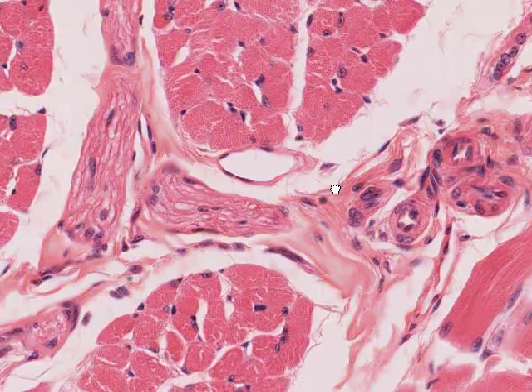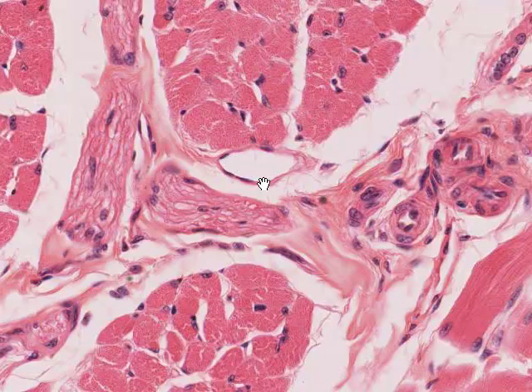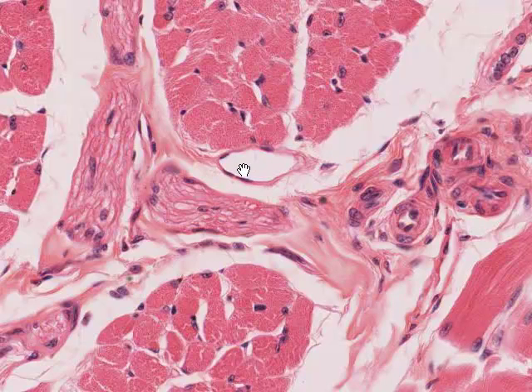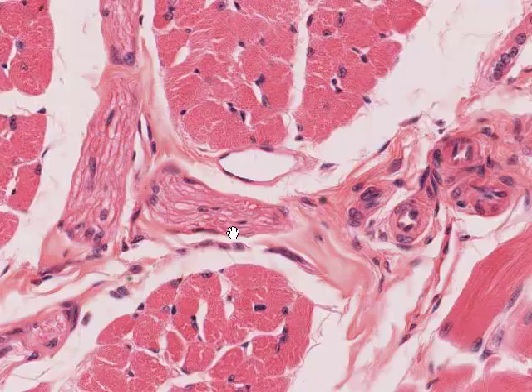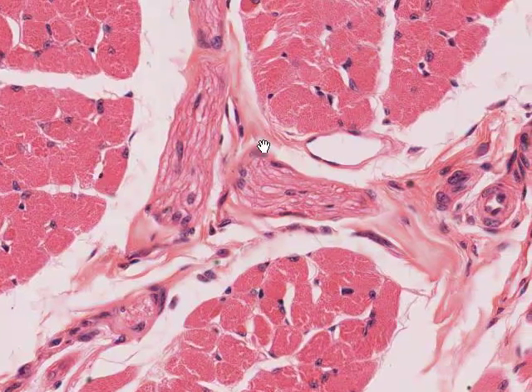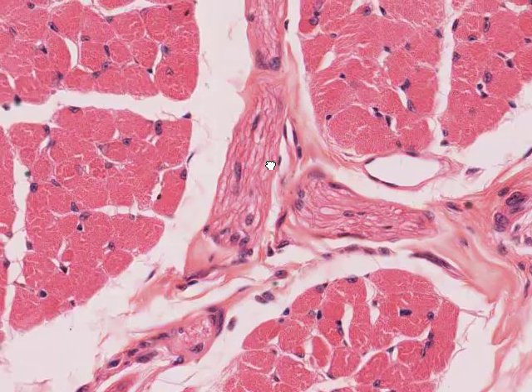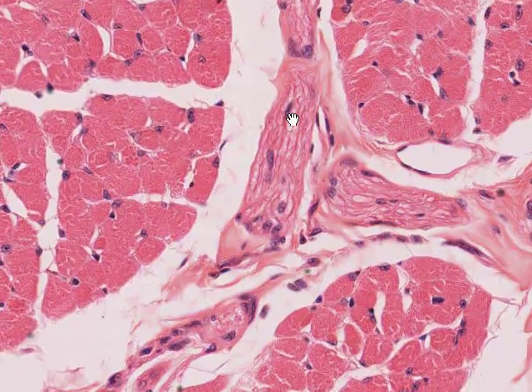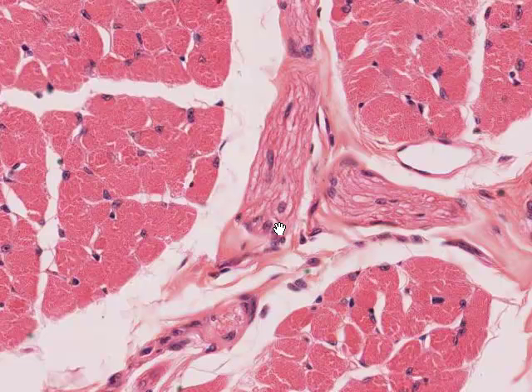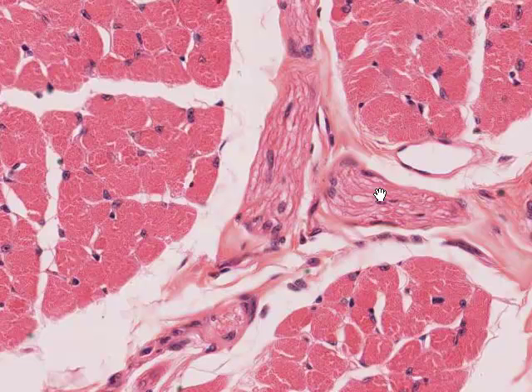Accompanying this cluster of arterioles is a venule — we can see endothelial cell, endothelial cell, endothelial cell. There is no real tunica media here because venules at this diameter have almost no wall structure whatsoever. Finally, accompanying this arteriole and venule is a piece of nerve, cut in oblique section and here cut broadly in longitudinal section. If we zoomed up we might identify a node of Ranvier, and the cell nuclei visible here belong predominantly to Schwann cells, which myelinate this peripheral nerve.